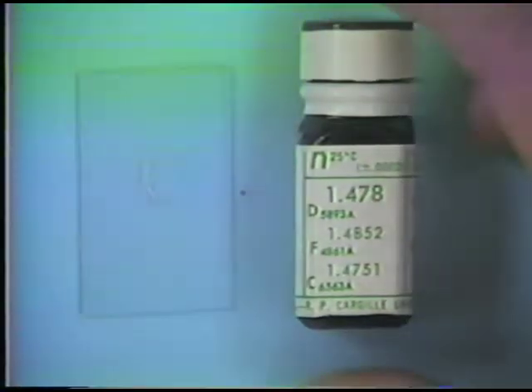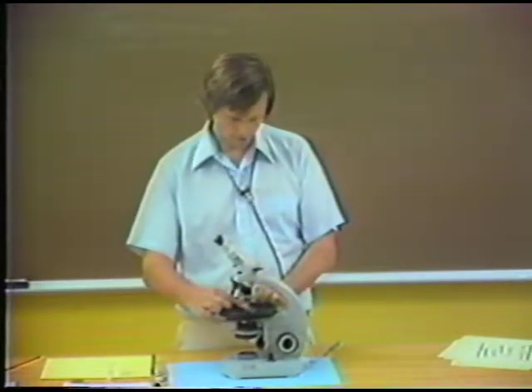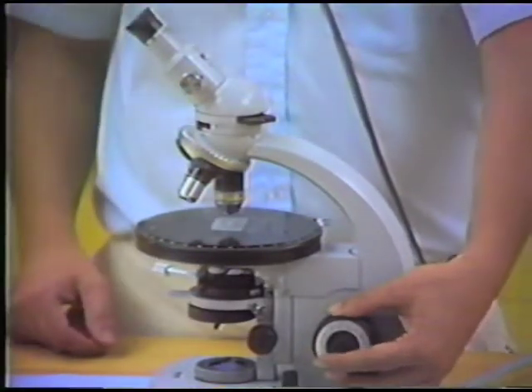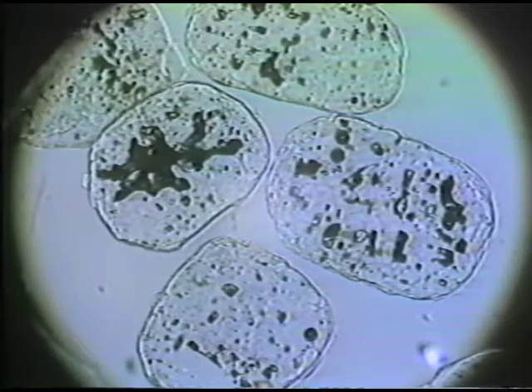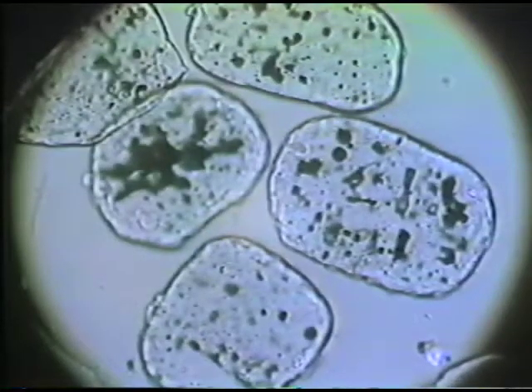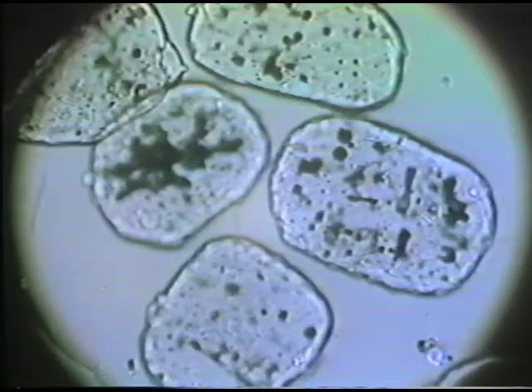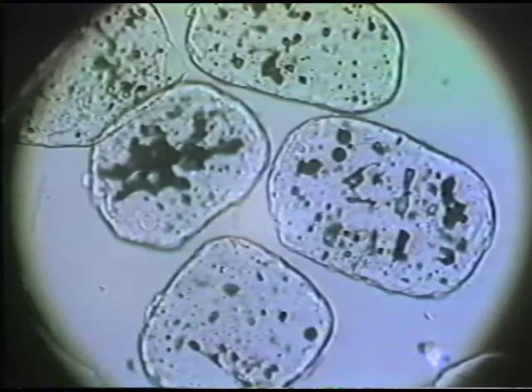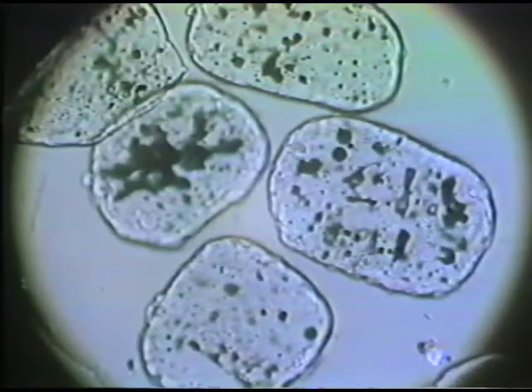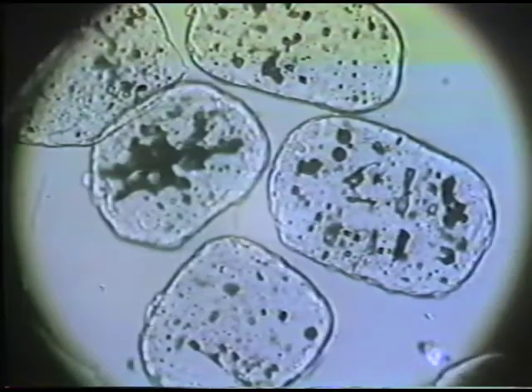So I have now a new mount, the same mineral, now mounted in a different index of refraction liquid. And I'm going to take this mount and again perform the central illumination test on this. So I've got the mineral grain again, observing it in plane polarized light, and I'm now lowering the stage, raising the plane of focus, and here I think you can see that the sense of movement of the Becke line in this central illumination test is the opposite. Now the Becke line is moving into the mineral grain as I raise the focus. The Becke line moves into the middle of the mineral grain.